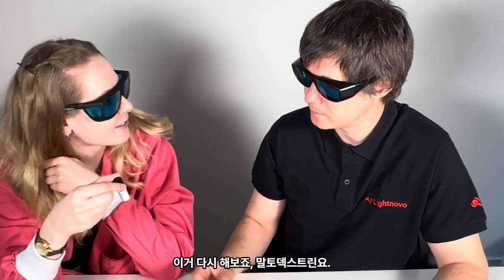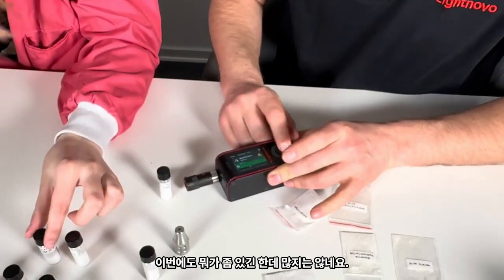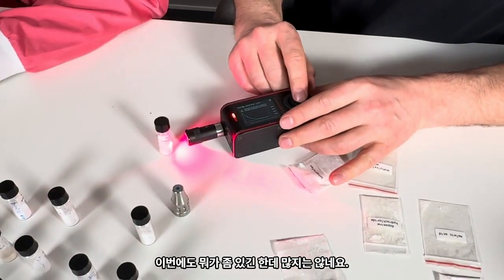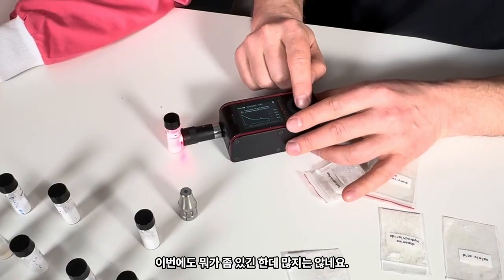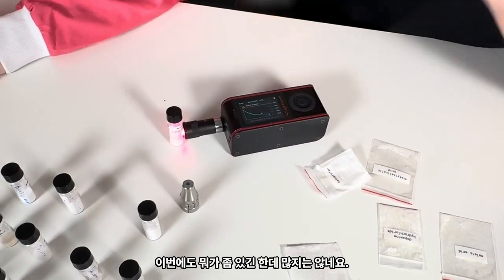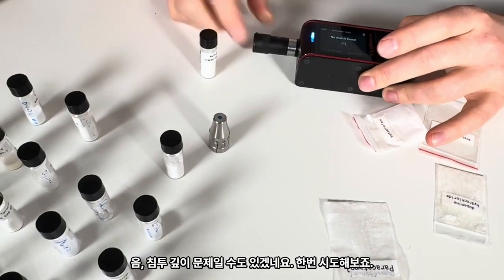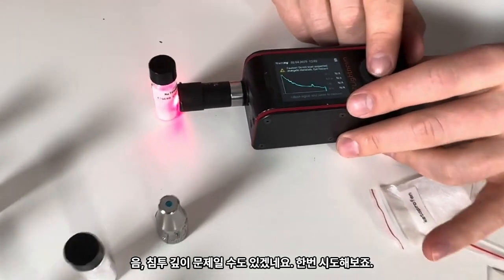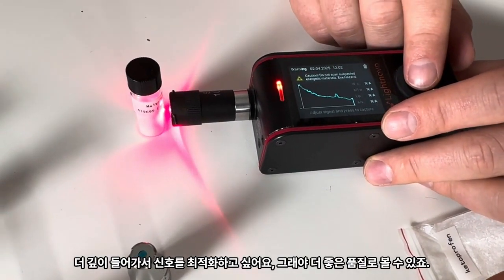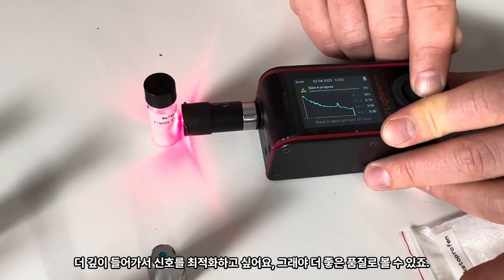Let's try this maltodextrin again. You are still curious. You are very curious about it. Okay. Maltodextrin again. There is something. Not much. Okay. Maybe penetration depth. Let's try deeper. And I would like to optimize the signal so we see better quality.